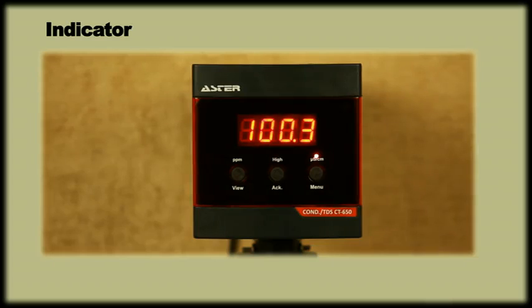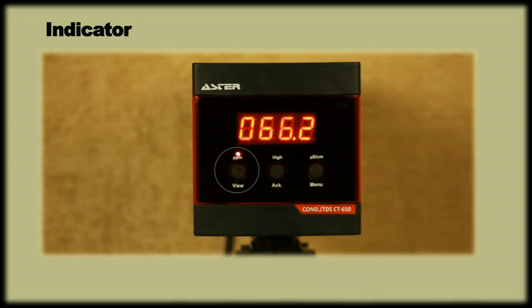Indicator. This is a digital indicator with 7 segment 4 digit LED display that receives the signal from the sensor and displays the readings in micro Siemens or PPM as selected by the user. It also sends out an alarm signal if the reading exceeds the set point.